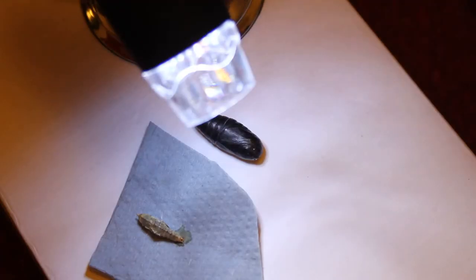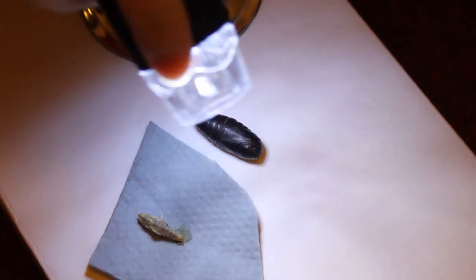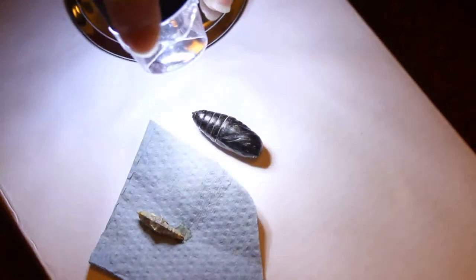Okay, so I've had a look under the microscope, and after 10 years I'm actually going to open this up. This is so strange. I could end up with just mush of nothing, or it could actually be pretty, pretty awesome.